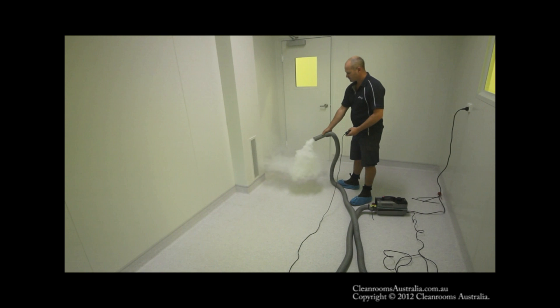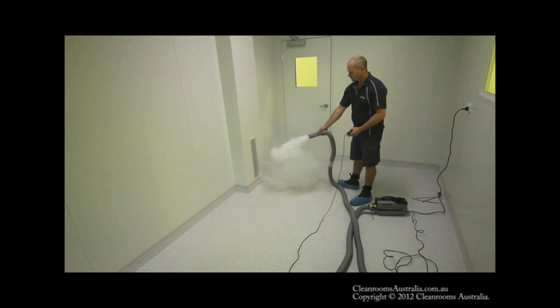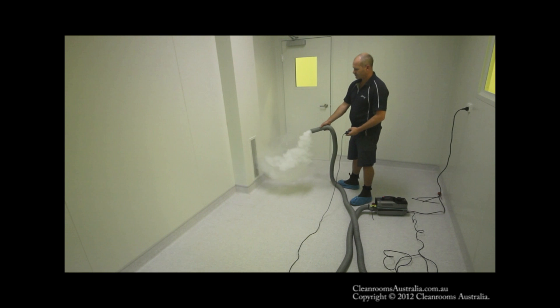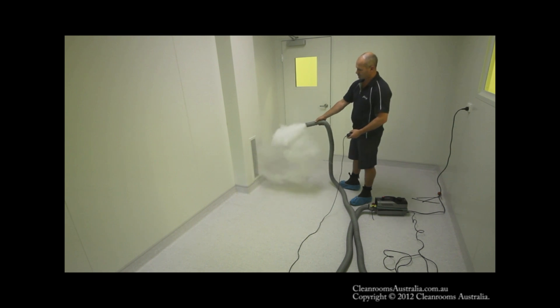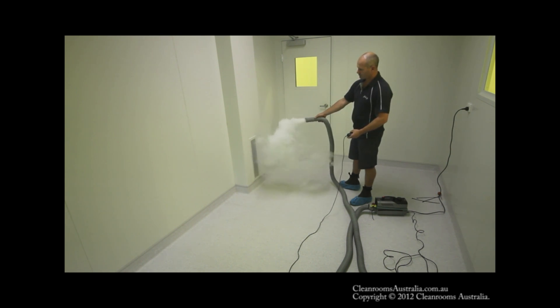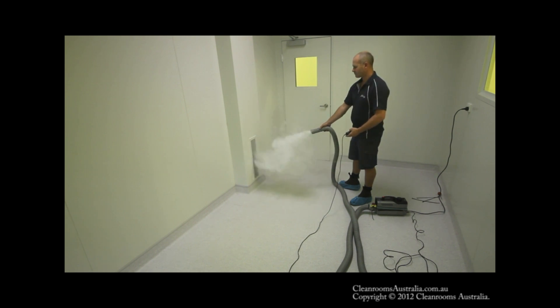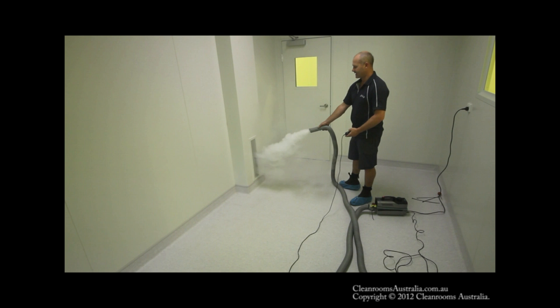With all these things taken into consideration, you can actually get some very good visualisations of the mixing of the air, the laminar flow, and the mixed flow differential pressures across the boundaries.